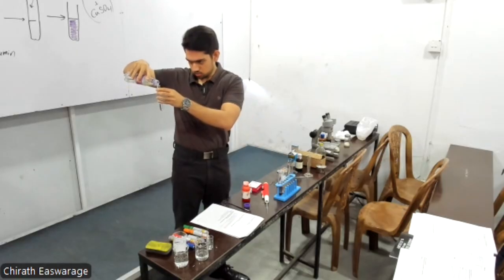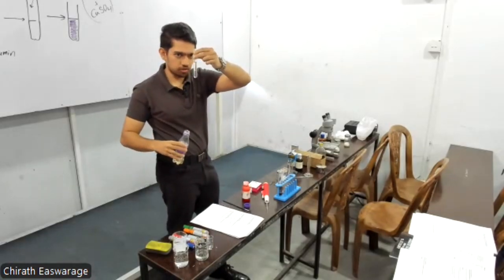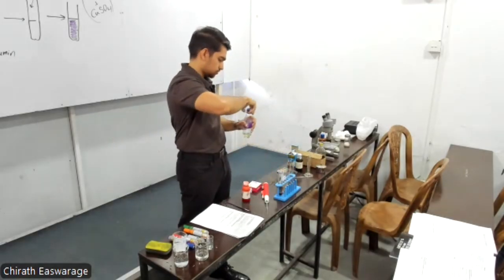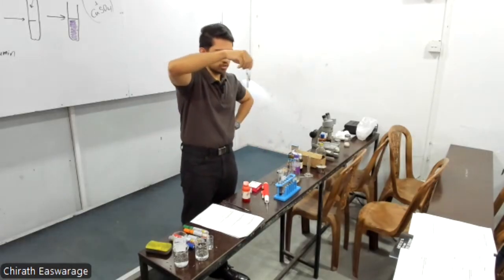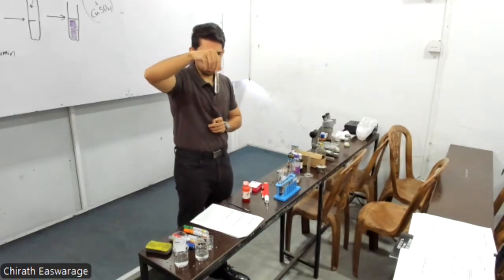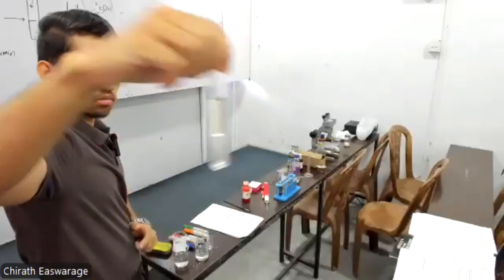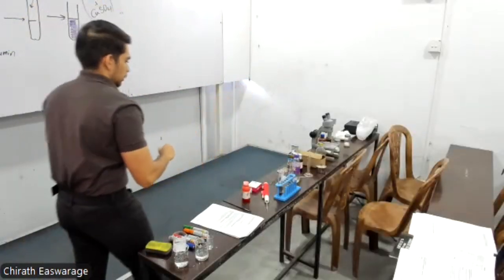What are we adding? We are adding some coconut oil. Can you see? Distinct separation of the coconut oil and the water layer. If you try to mix it, is it going to mix? No, they don't like each other, so it's not going to mix. Online students, can you see? Right? You can see the water layer and the oil layer above, right? Because the water is polar and the oil is non-polar.